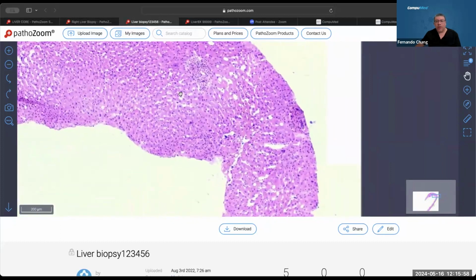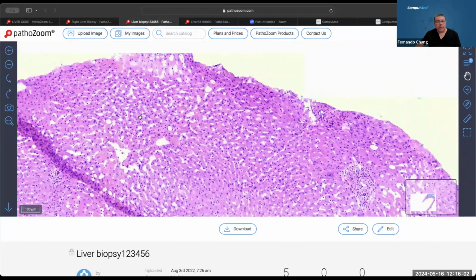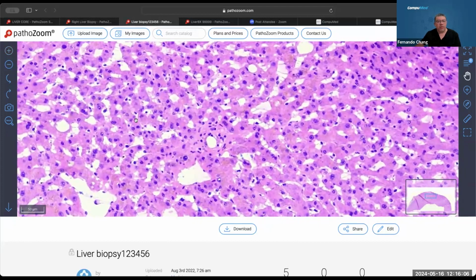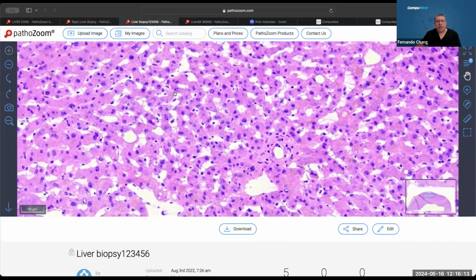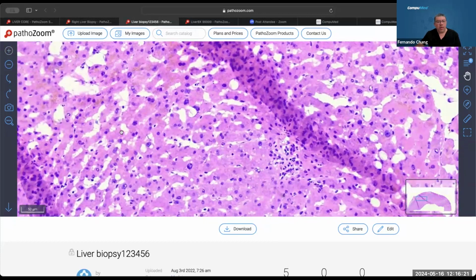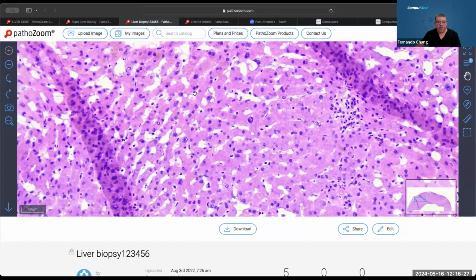Staining, really good. We have triads, we have a lot, and the reason I chose this one is because you can see closer and approach that. You can see the nuclei. I don't know if you can see that. Yes, right here, you can see the nuclei with little holes. And this is the type of nuclear vacuolization that we have, so it's a freezing artifact.